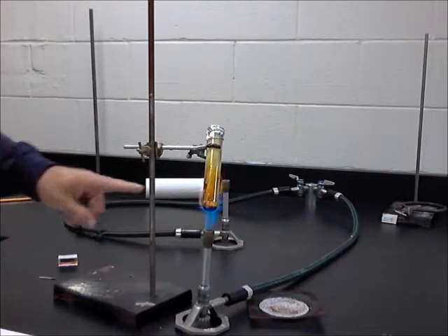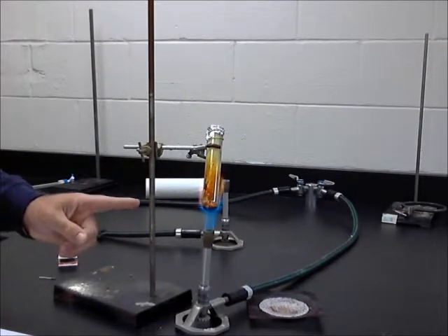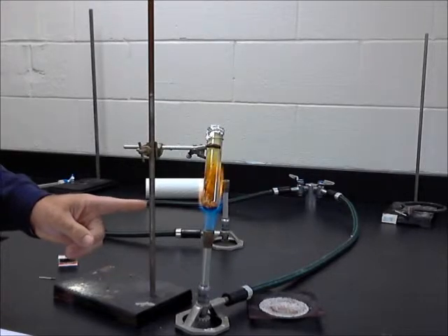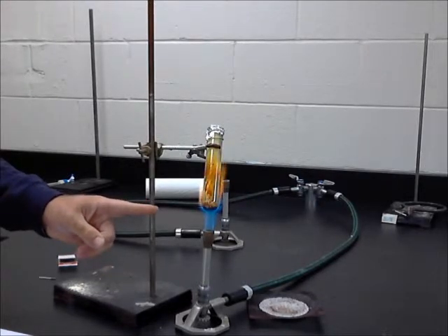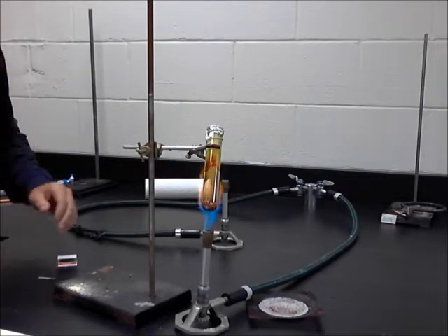Once you see gases forming inside here, the sulfur immediately turns black. Stuff starts mixing up, and once you stop seeing any changes occur, we can simply stop heating the test tube. And at this point, to me, it looks like nothing else is occurring. I'm going to turn this off.